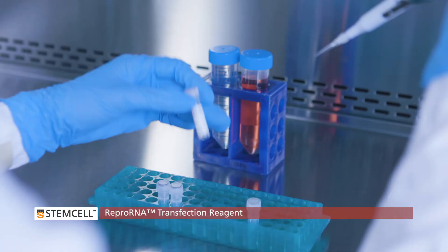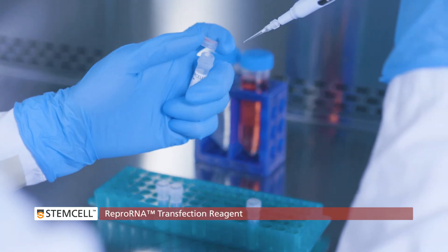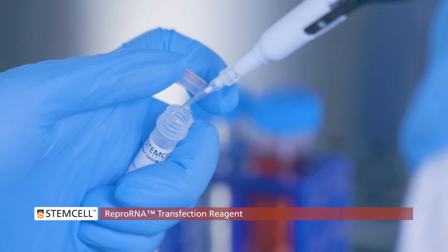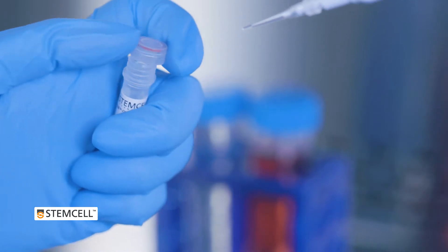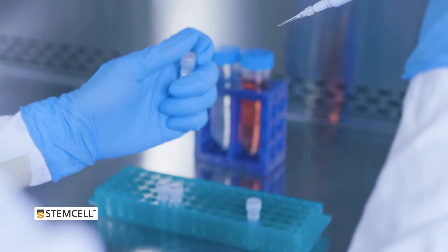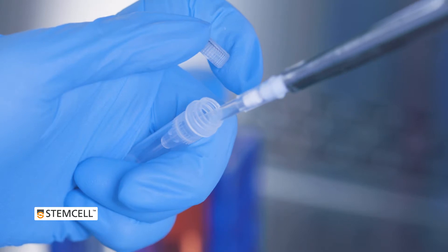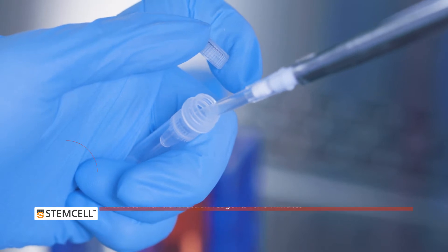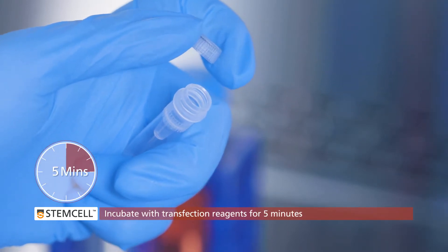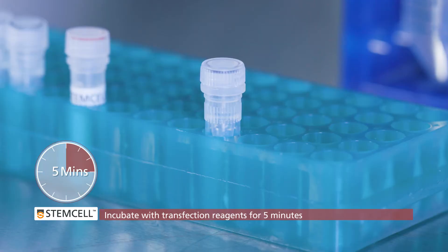The ReproRNA OKSGM self-replicating vector only requires a single transfection. For transfection, we recommend using our ReproRNA transfection reagent. Simply mix the ReproRNA OKSGM vector in a tube with the transfection reagents and incubate for five minutes.